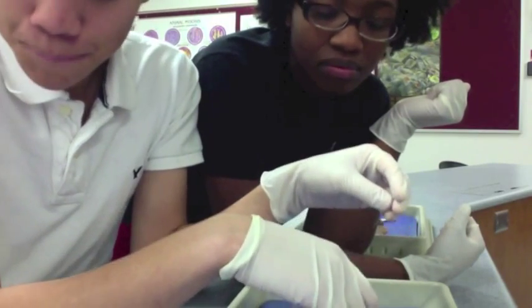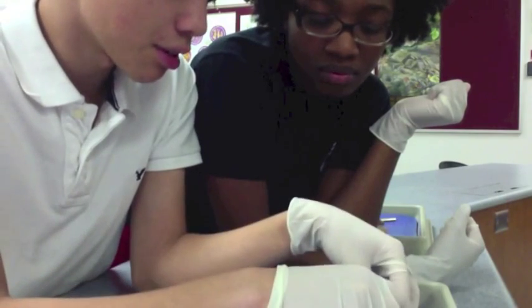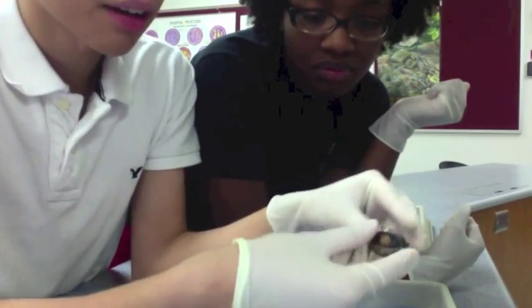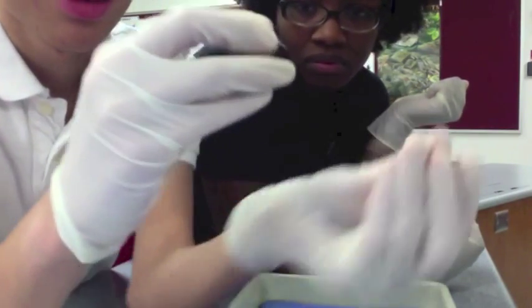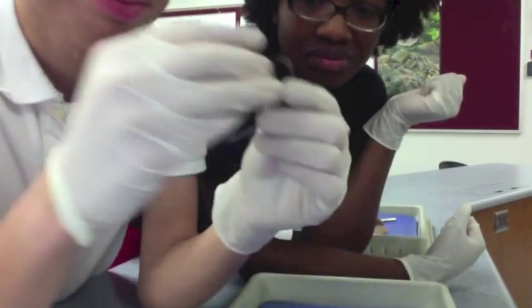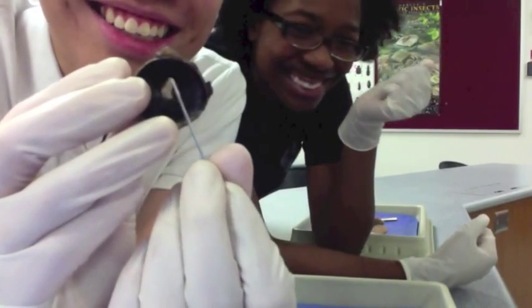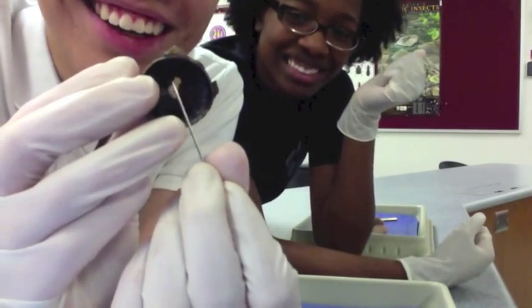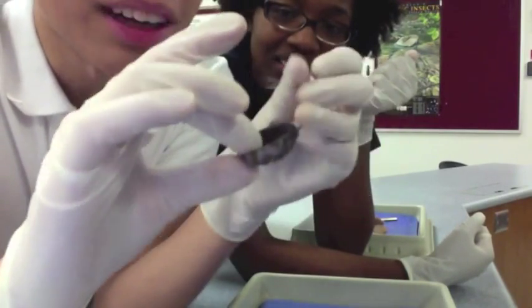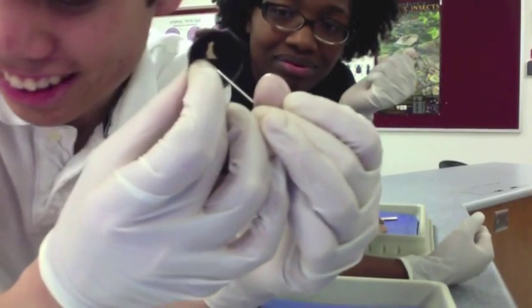We have your ciliary bodies. The black area right here — that's your ciliary bodies.